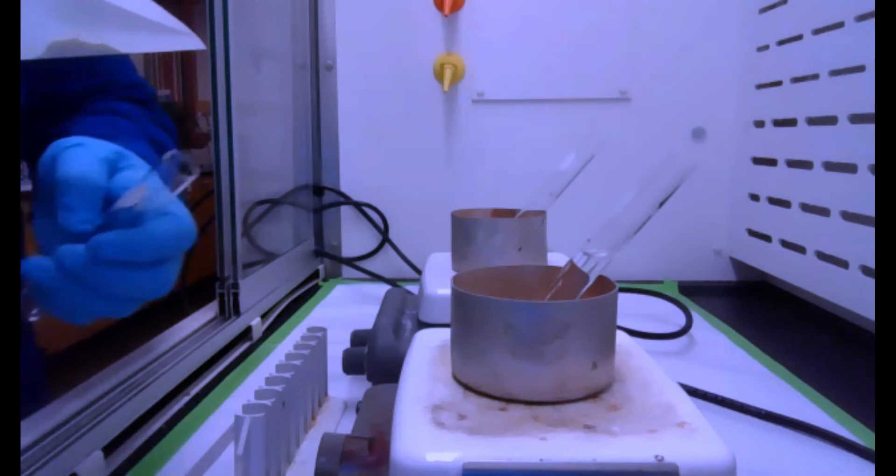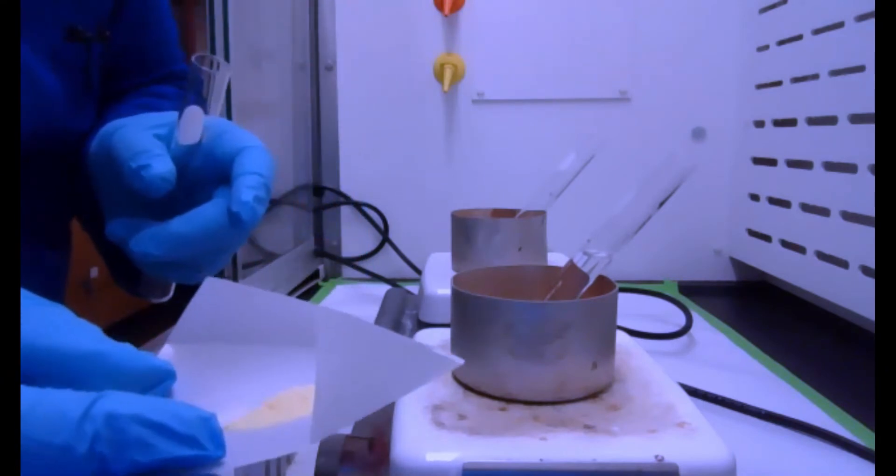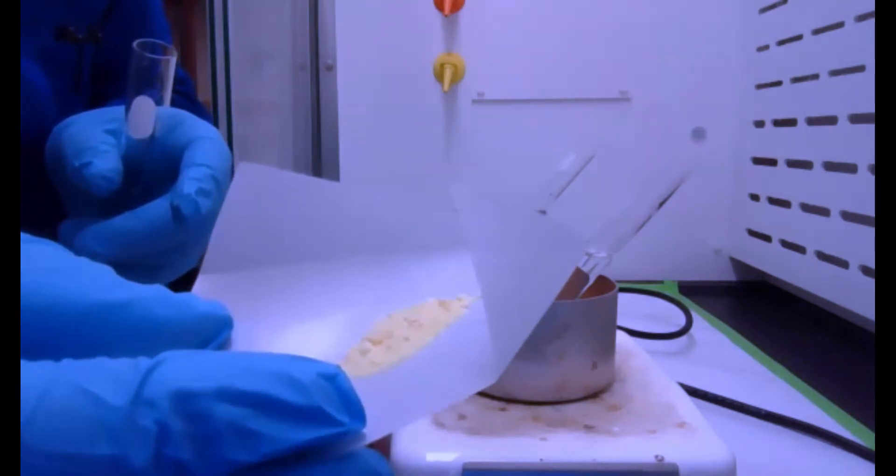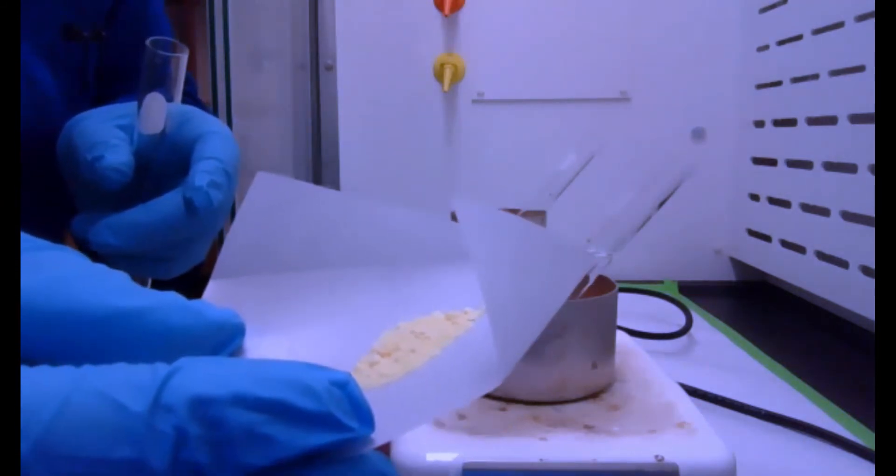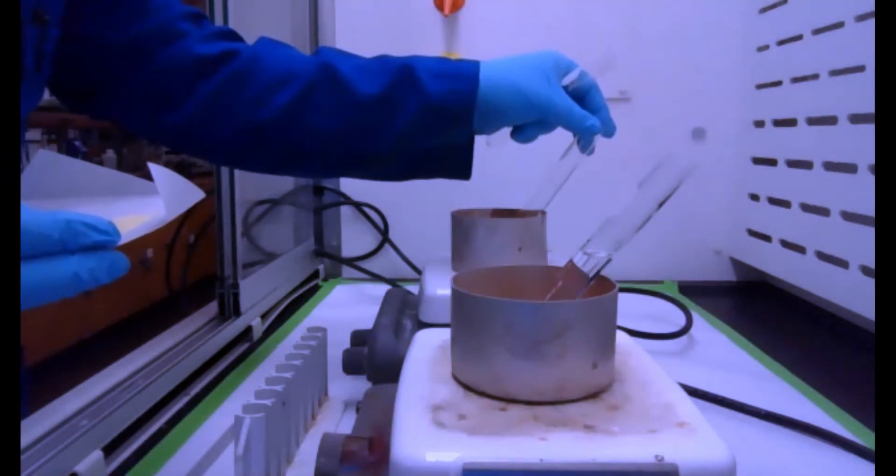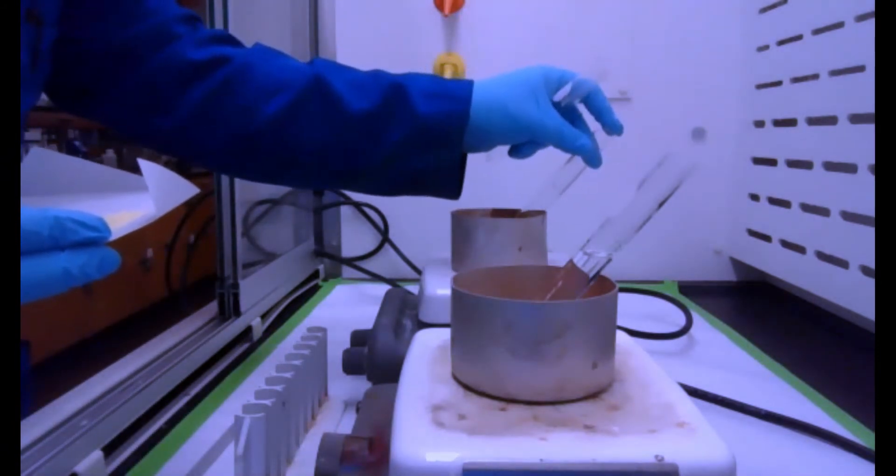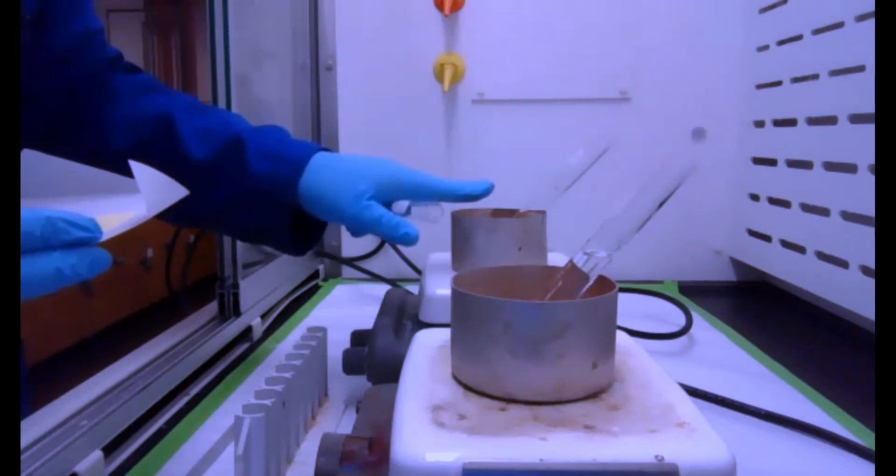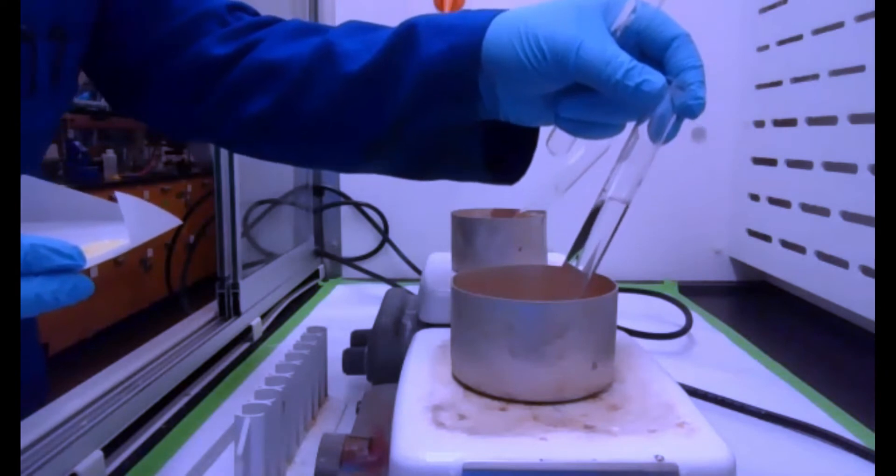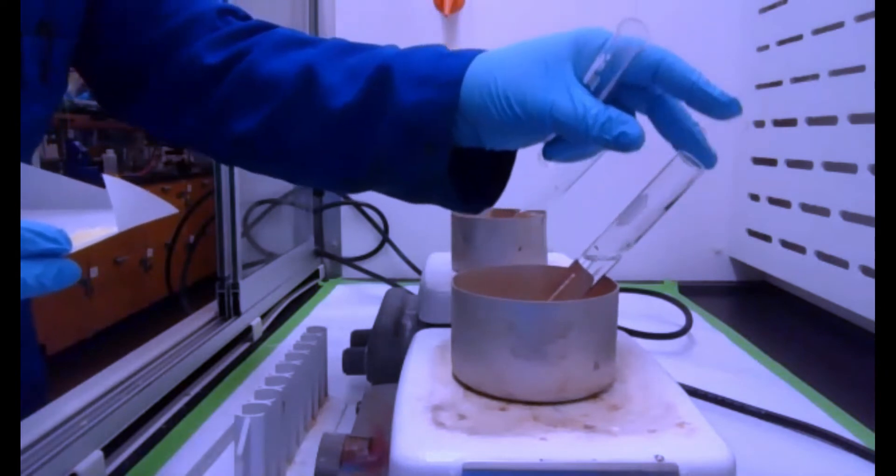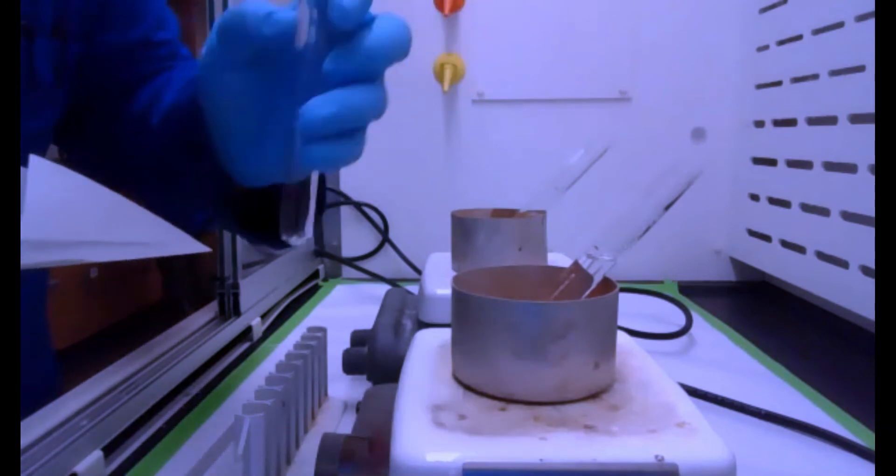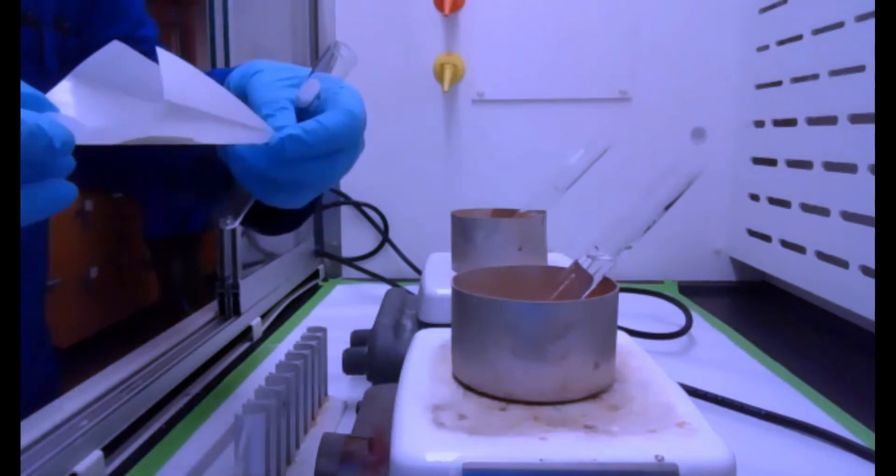Okay, so I finished drying the product and got a crude yield, as you can see here, yellow solid. Now we're going to do a recrystallization, so in one sand bath here, I have ether hot, so this is at a lower temperature. It has a lower boiling point, and on this one, I have hot toluene, so I have two solvents already hot, and I'm going to take our product and put it in the test tube.